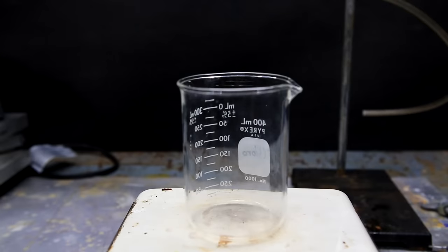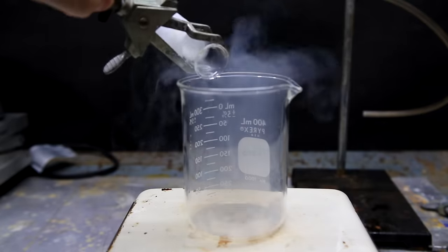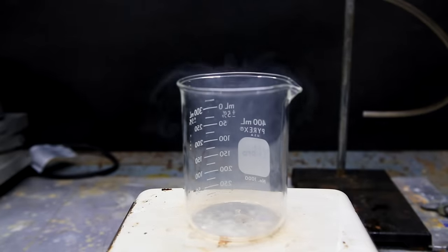For our first experiment we pour some liquid oxygen into a beaker and we lower some pre-ignited steel wool into it. As an added bonus, my friend offers an excellent commentary to the reaction.